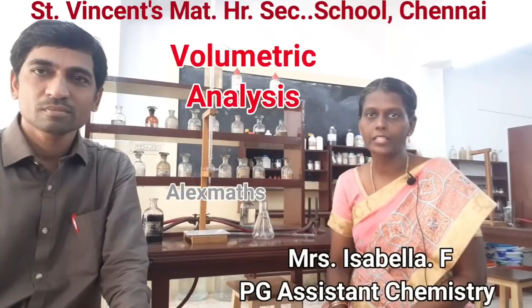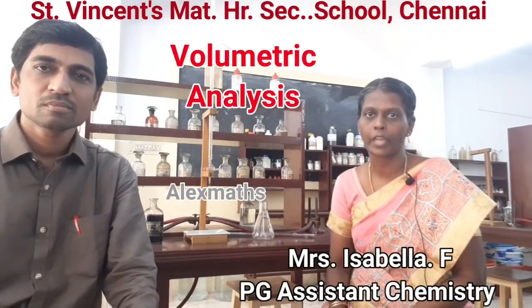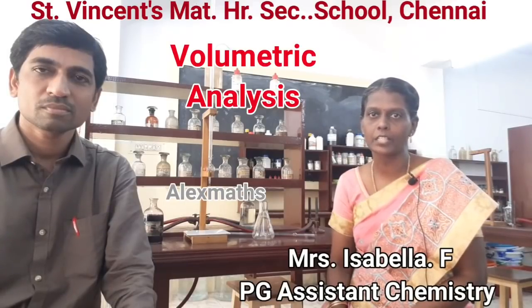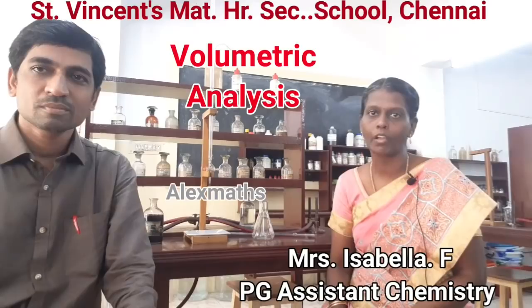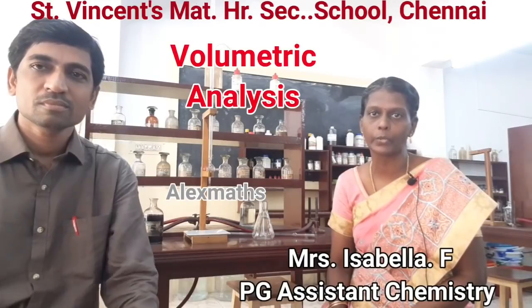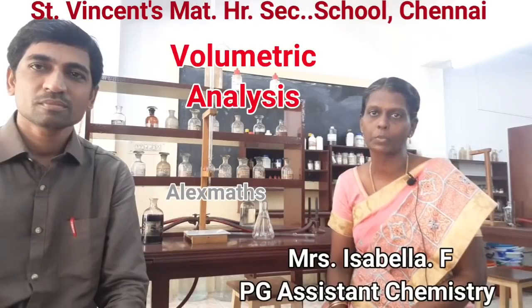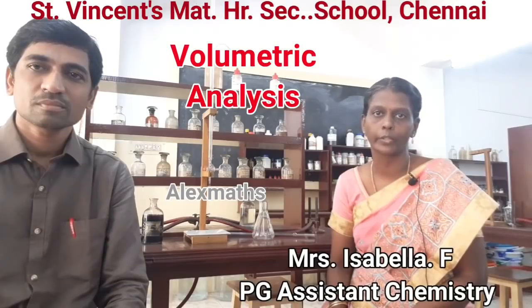Now the word analysis means to find out, and volumetric is to measure the volume. Therefore, in volumetric analysis, we are going to find out the concentration of a given solution by measuring the volumes of solutions which react with each other. Concentration of a solution is nothing but the amount of substance present in a given definite volume.